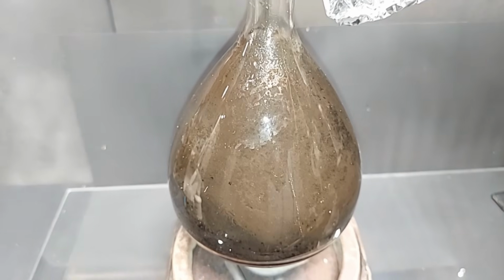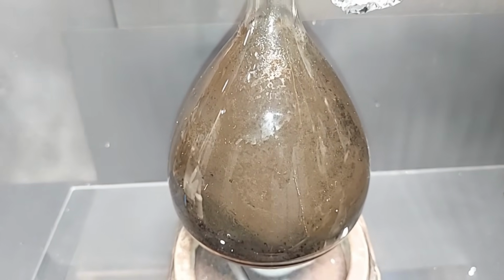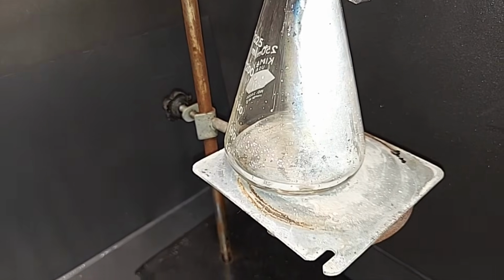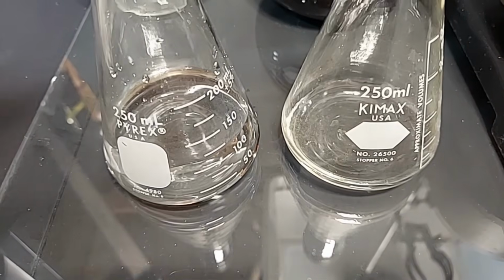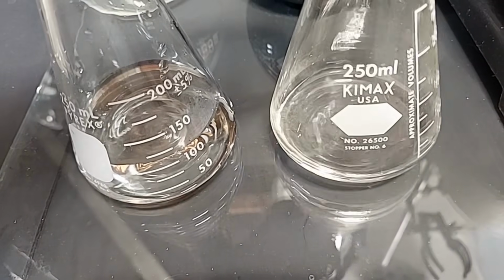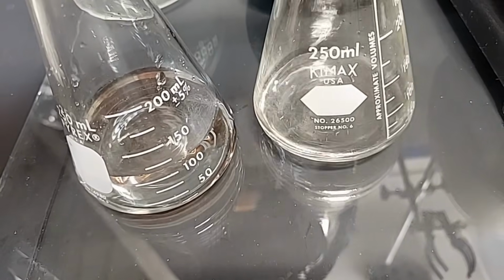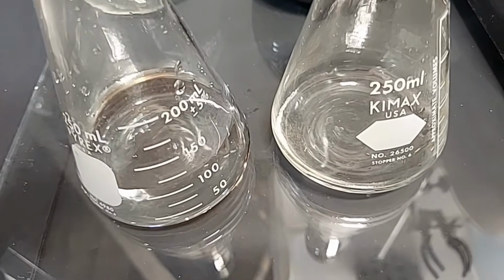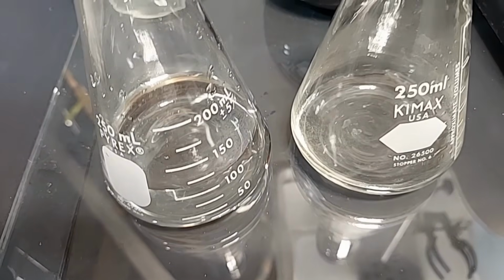It's really remarkable when you look at distillation. You can take a grungy mess like that and turn it into such a clean solution over here. These are the 2 flasks I just used. This is the water here, that's about 140 milliliters, and the acid on this side is, I don't know, maybe around 25 to 30 milliliters. So if you add those together, you're going to end up with 160 to 165 milliliters. The reason there's not 200 milliliters total is because of this mess in here.